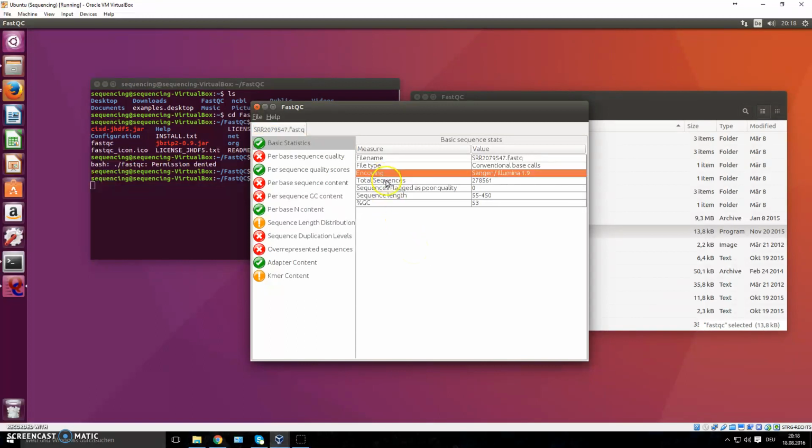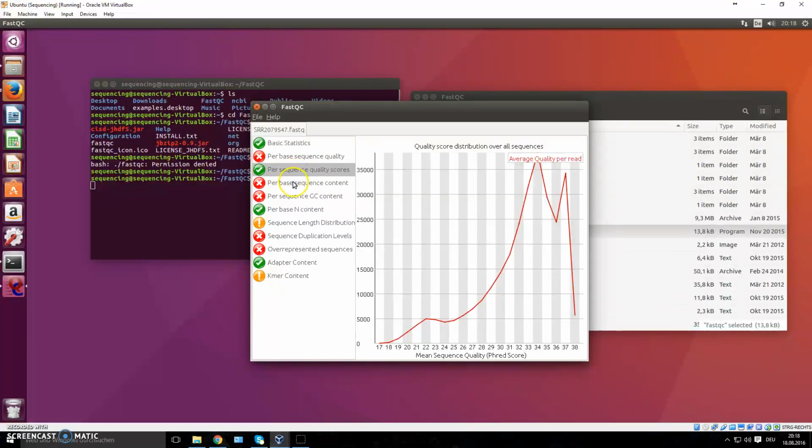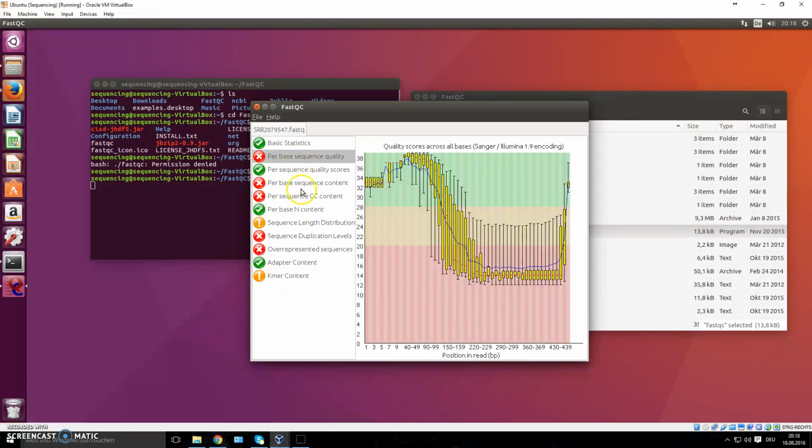So for instance, we see that the total sequences in that file are almost 280,000. It tells you the encoding of that file. This was sequenced using a MiSeq machine, and it gives you a lot of information, like also the GC content and what the sequence length is. Now here on the side, you will have information on the different quality scores and other things that are relevant for your later analysis. One of the most important parts is this right here.